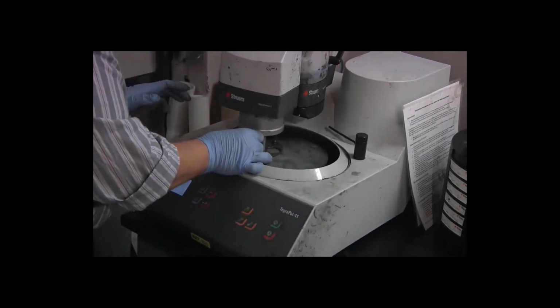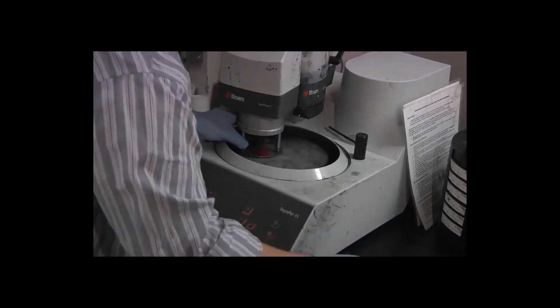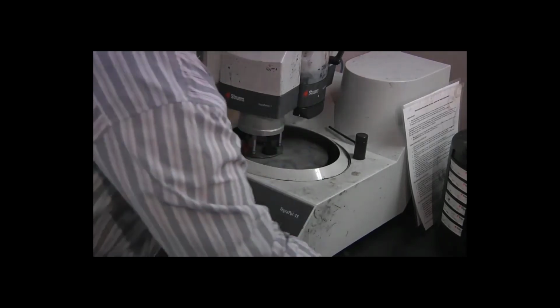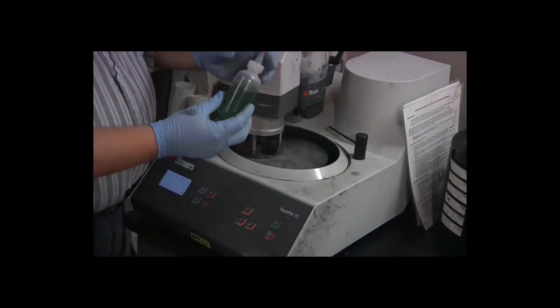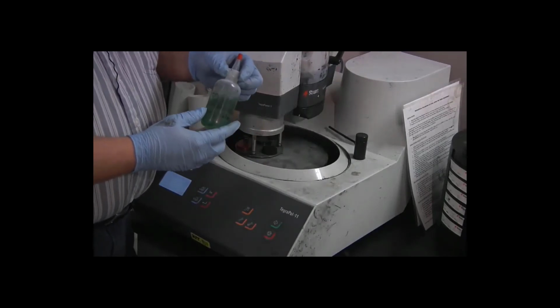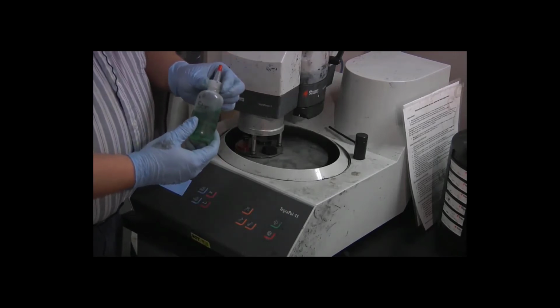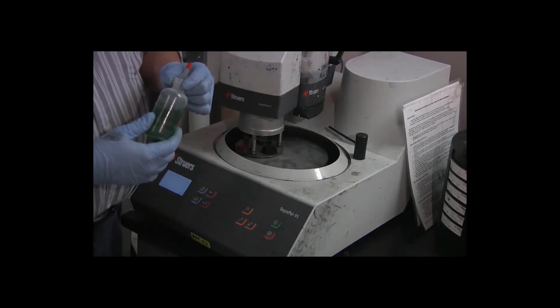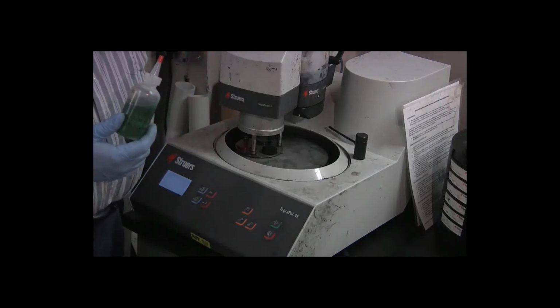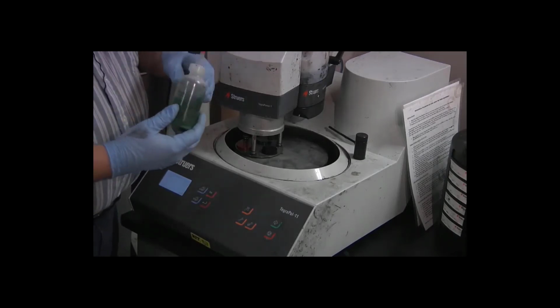Place the specimens face down on the polishing disc. And the last thing we do, we have this squirt bottle containing a green lubricant. For the grinding, the water served as a lubricant, coolant, and to flush away the residue from the grinding process. We don't have anything to serve that function for the polishing. The diamond slurry doesn't have enough liquid in it to serve that purpose. If we used enough, we would be really wasting material.